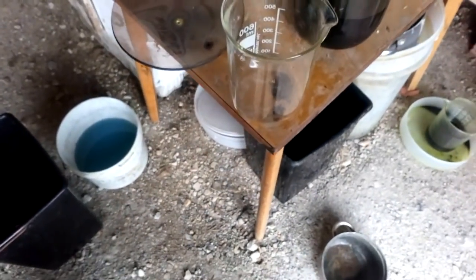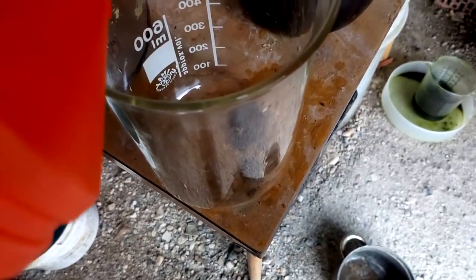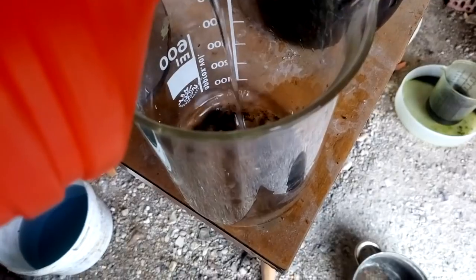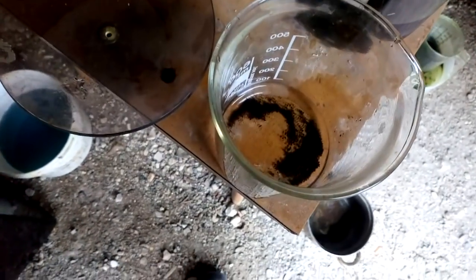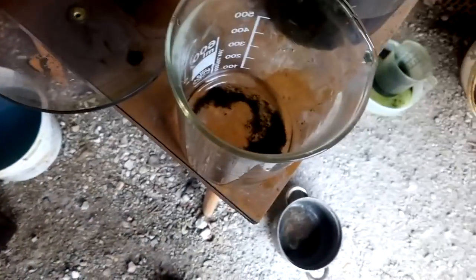I will add about 100 milliliter water and acid — not too much, maybe not 100ml. And just a little bleach.